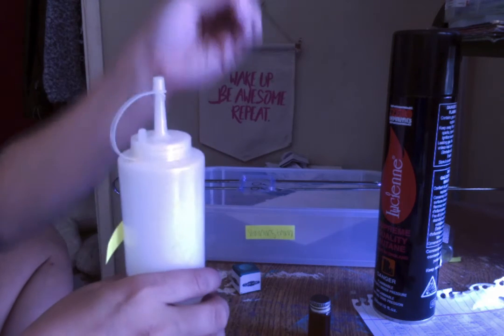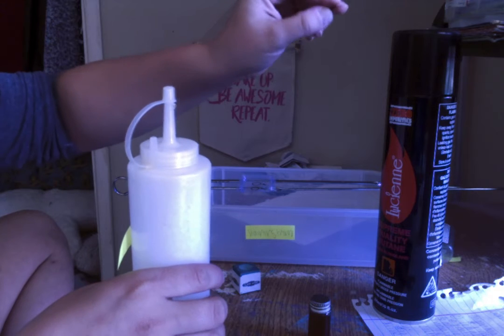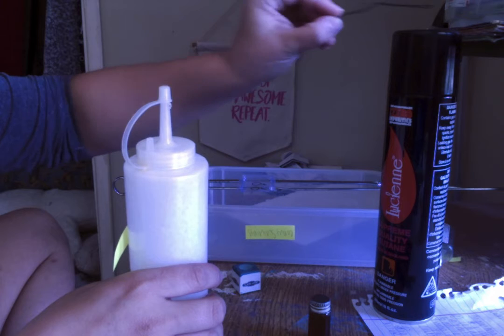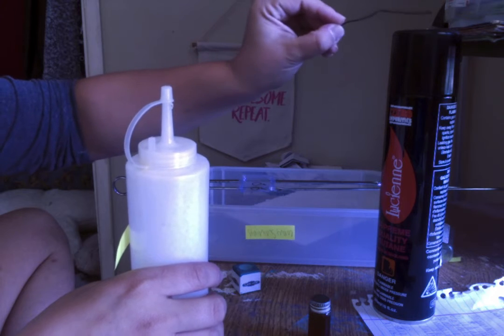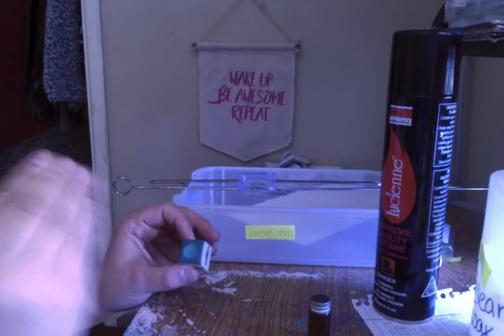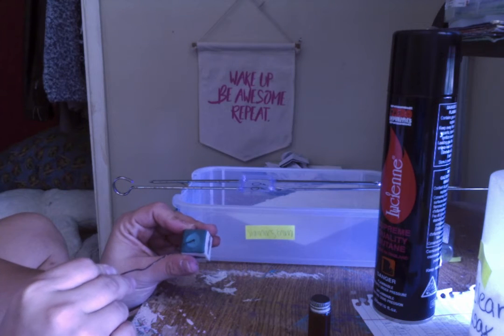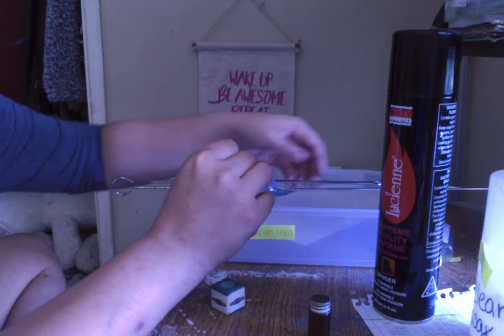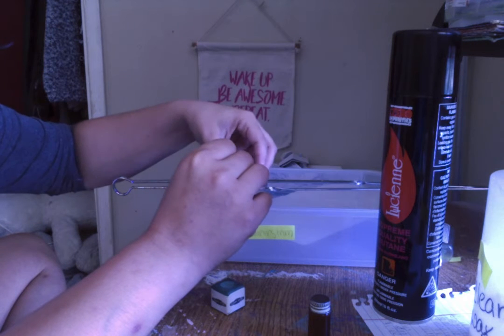And then again, because water is not always completely pure, you're going to want to put the inoculating loop back over the Bunsen burner, and then you're ready to collect a small, barely dab of the solid bacteria, and then put it on top of the water so that it mixes well and you're able to get a good bacteria smear.